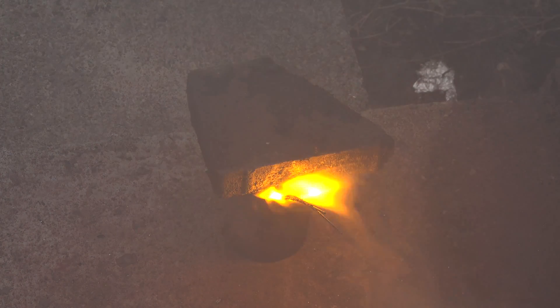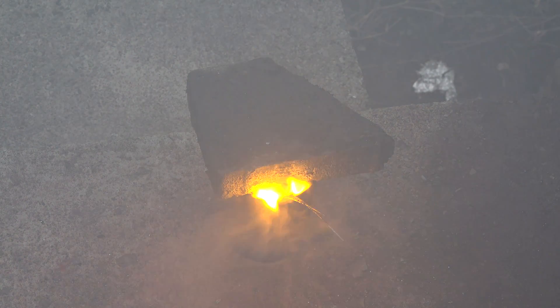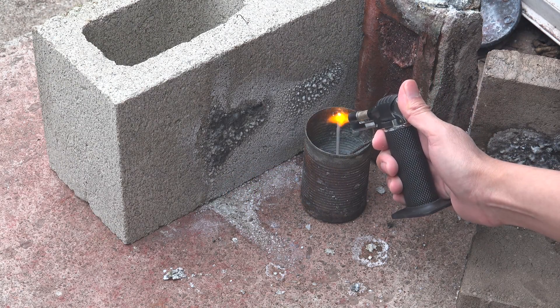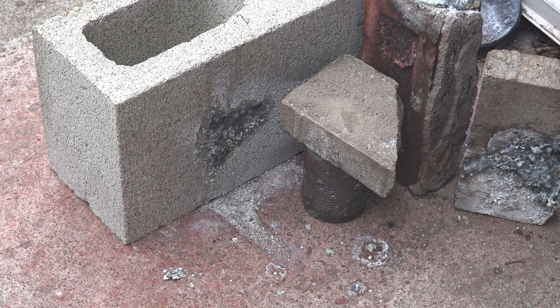If you leave it open while it cools then most of the sodium produced will be oxidized by the air. The lid needs to be heavy so the hydrogen flamethrower doesn't blow it off. I left open a tiny crack to fit sparklers in, but this is a bad move since more air can get back in. I later realized you could just cut the sparklers, ignite them, and then cover the container completely.